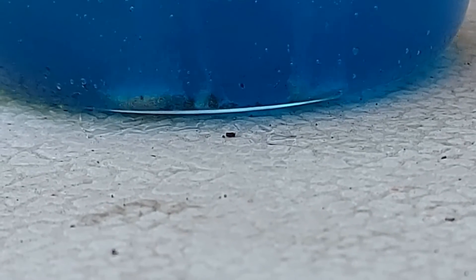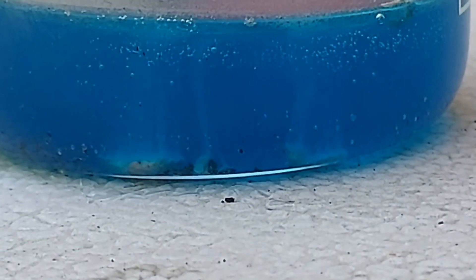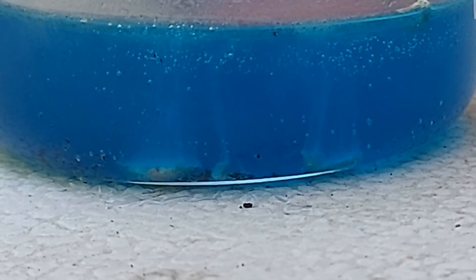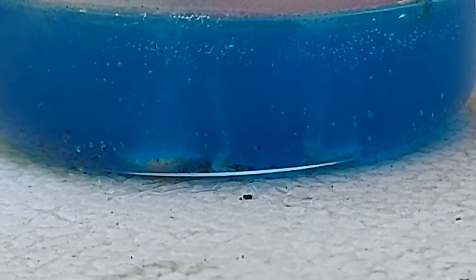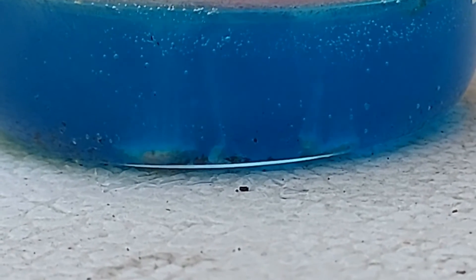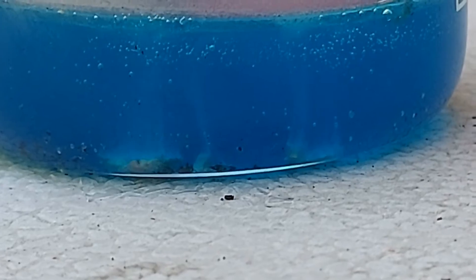The copper is dissolving into smaller and smaller pieces. The brownish gas I mentioned earlier is nitrogen dioxide, and it is extremely dangerous — but outdoors like this it gets blown away everywhere, so it's fine to be close to it, just not too close.